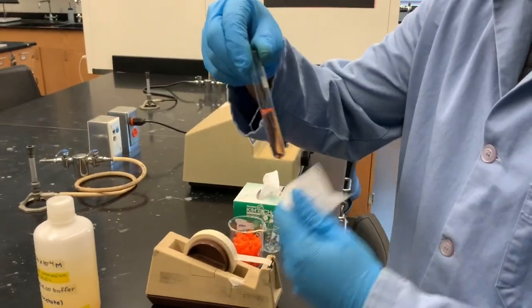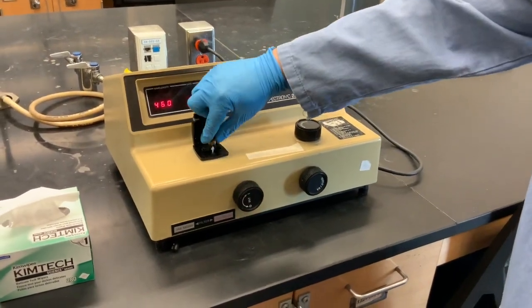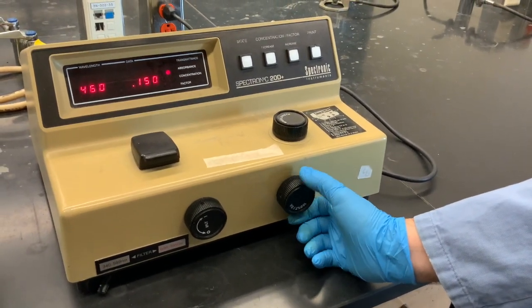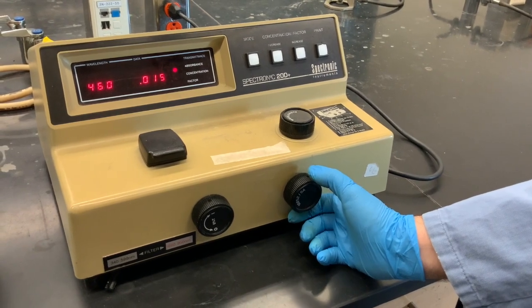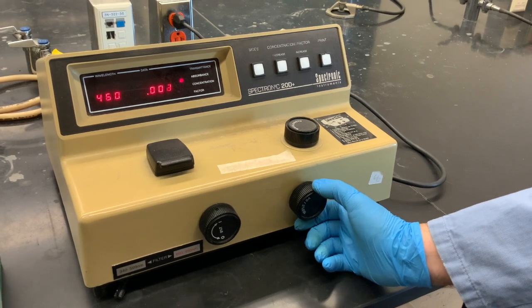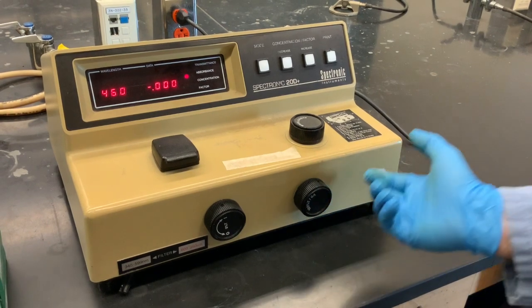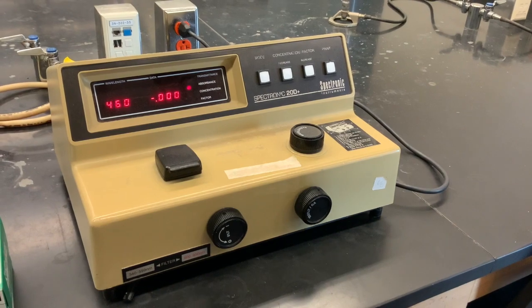into another cuvette. To find lambda max, we place the cuvette containing the blank solution in the spec that is already set at 460 nanometers. We then adjust the absorbance reading to 0.000 to make sure we start at the right background level. As discussed in the pre-lab video, this is the same as what you do when you tare a balance to make it go to 0 before using it to weigh an object.